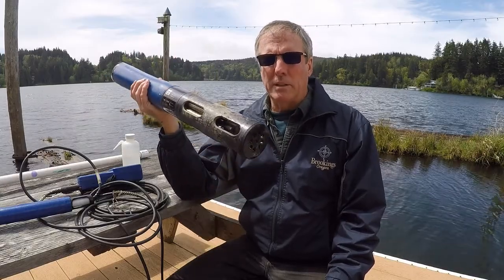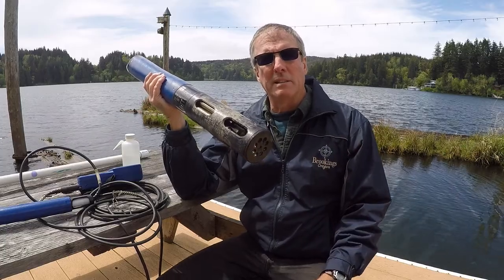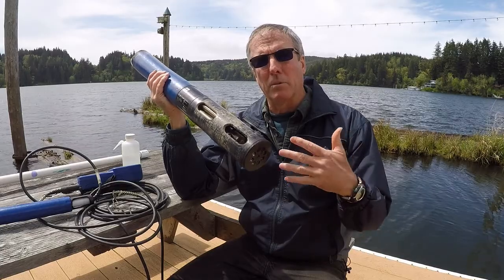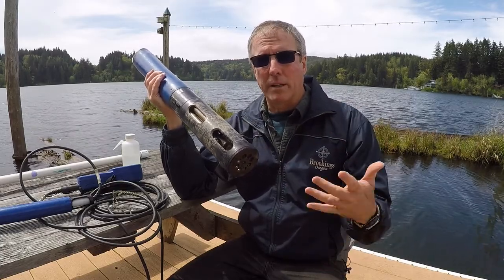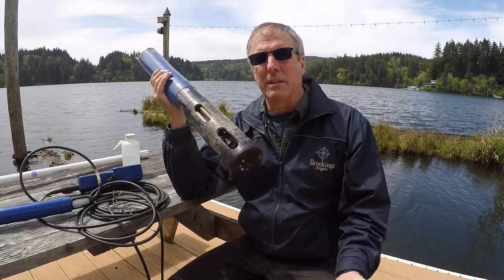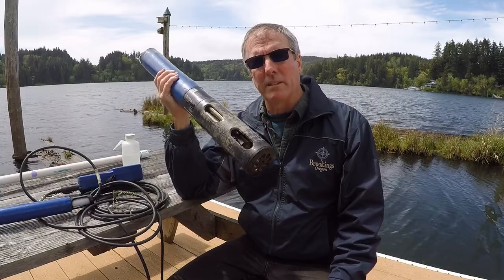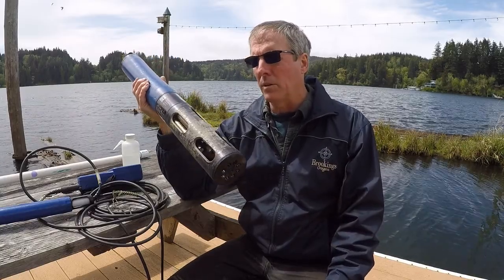So these are all real and important in analyzing, doing a deeper understanding than you would normally get with your multi-parameter probe, where you're only taking a reading once every week or two. Even if you just came out and did it every day, this is still going to tell you way more than that would, because you just have so much more data to be able to correlate.